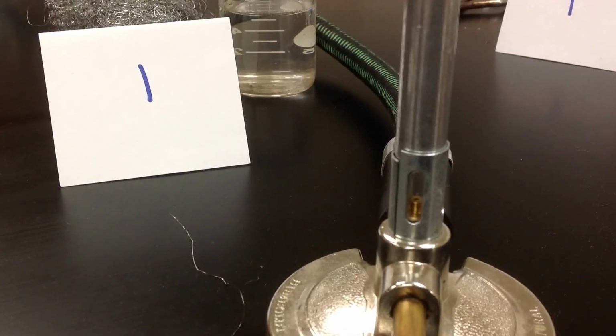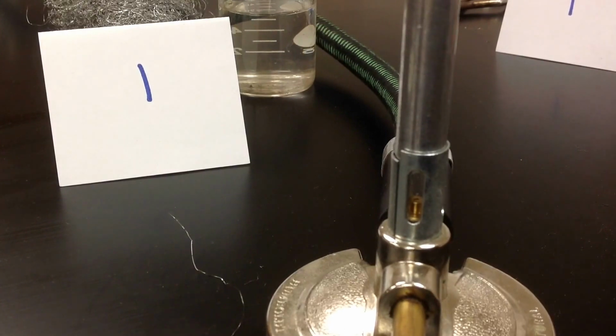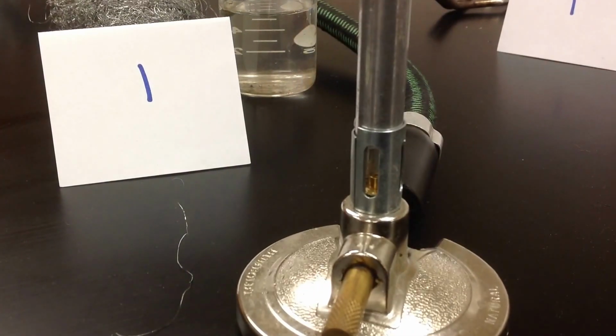Okay, so we're going to do all the chemical reactions that are involved in the types of chemical reactions lab, and I'm posting it here on YouTube so that if you're absent, you can go ahead and fill out the absent sheet.